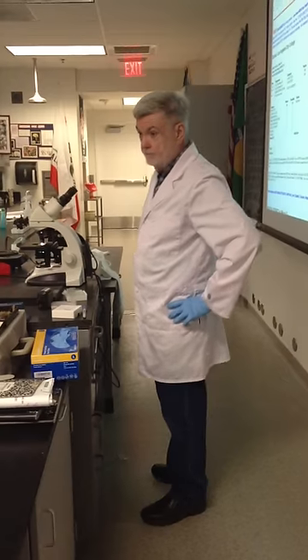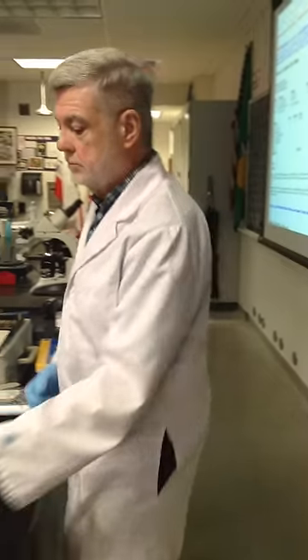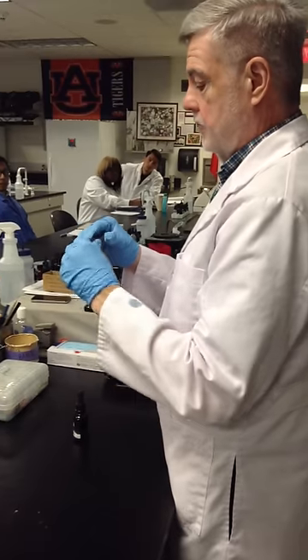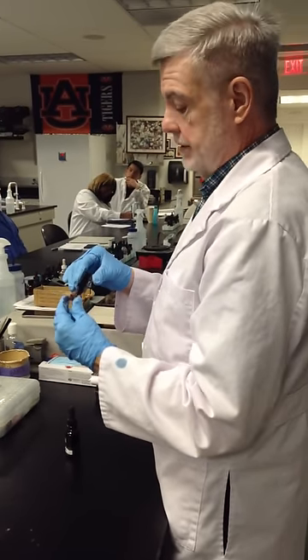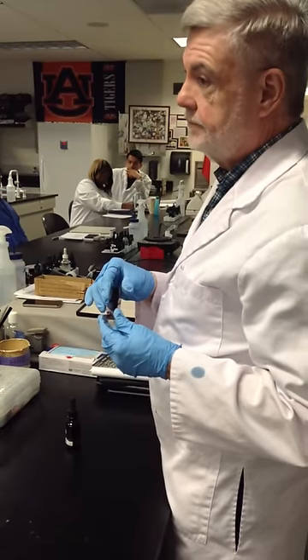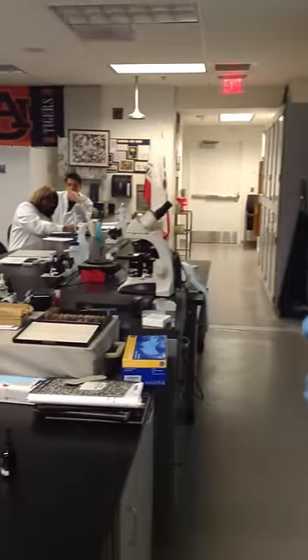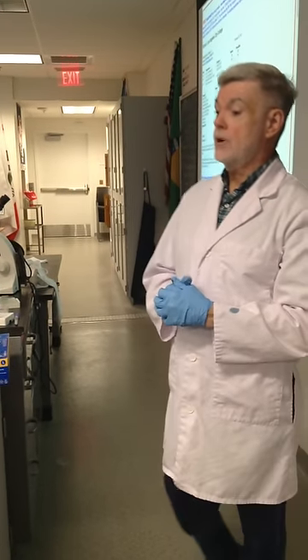If the dirty slide was just laid on, you wash it and take it home clean. Drying usually takes about 10 minutes — you can see it's still shiny so it's not dry. You don't use a cover slip; put the oil directly on the slide after the dye has dried, for every single stain we're using.